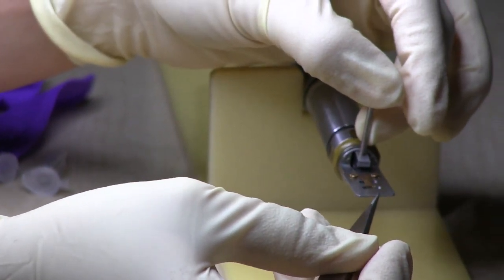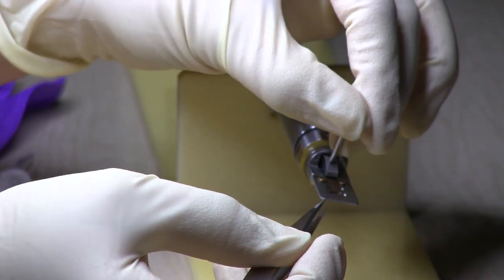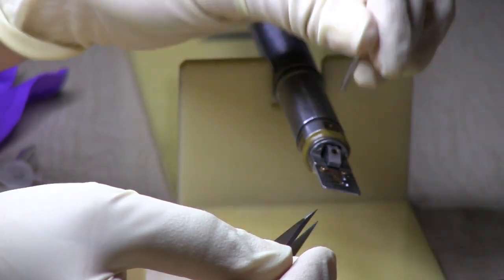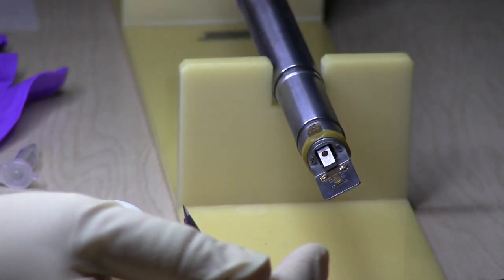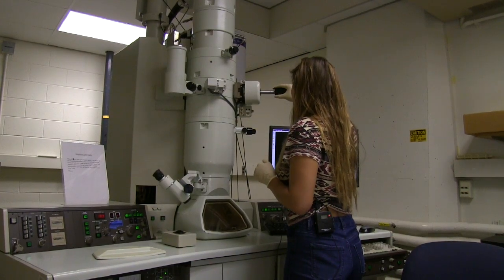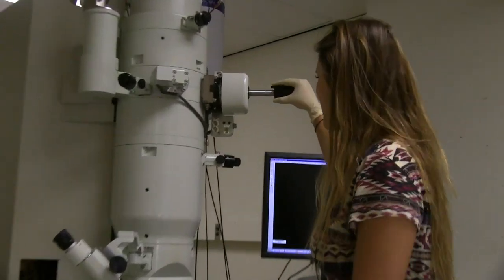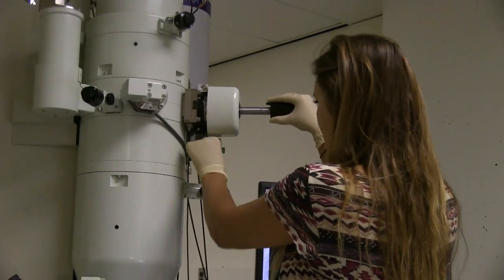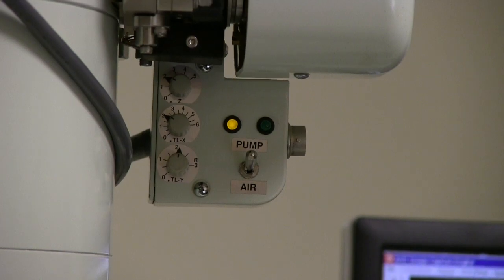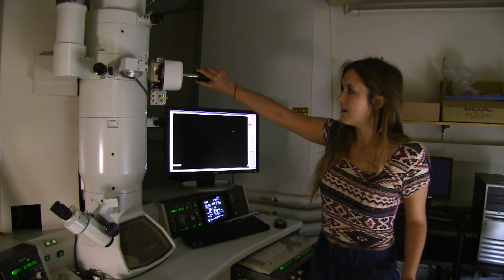I have quite a bit of experience with characterization because I worked in a characterization lab for two years. But this summer is my first time using transmission electron microscopy. I also gained a lot of experience with wet chemistry, coding, data and image analysis, and just planning and executing controlled experiments. Gaining the skill to work with transmission electron microscopy allowed me to look at the quantum dots I made almost down to the individual atom level.